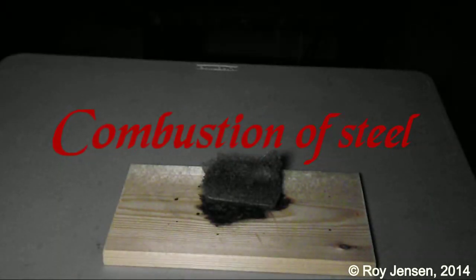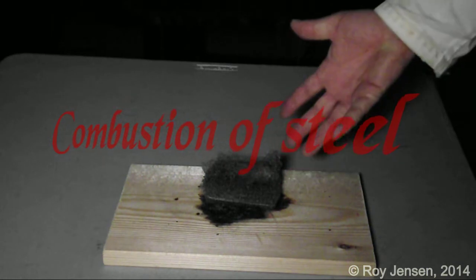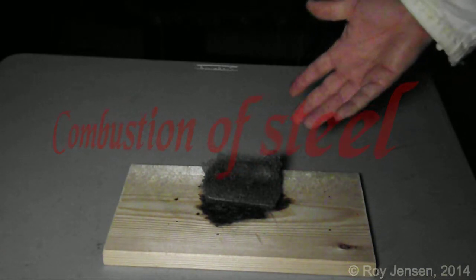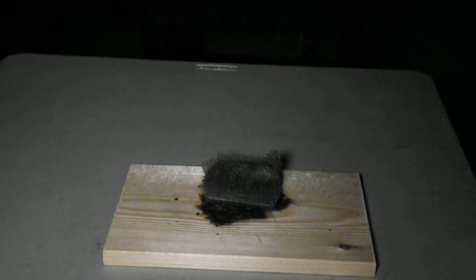What we have here is simply a piece of steel wool. One of the things mentioned earlier, and we're going to see a little bit later on in this course, is the idea that when we have solids, it is a reaction that occurs at the surface. So if we increase the surface area, the reaction will go faster.